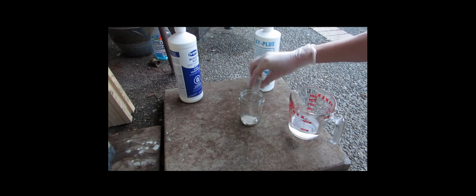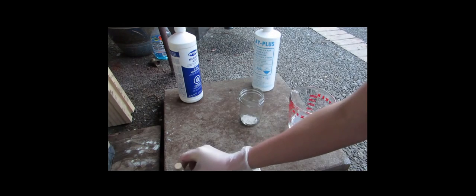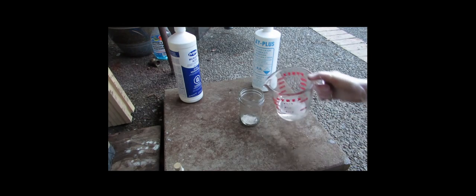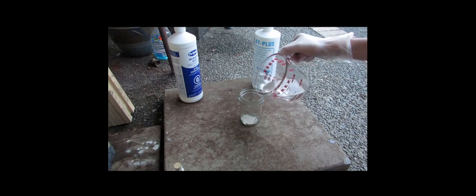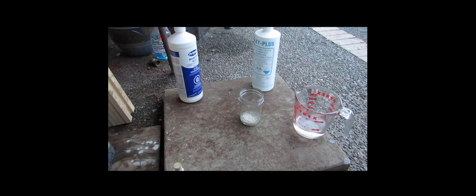I do think that this will work, so I'm going to put a fair amount in. And we just need to dissolve it in a bit of water. So here, I'm going to stir that around and I'll be back when it's dissolved.